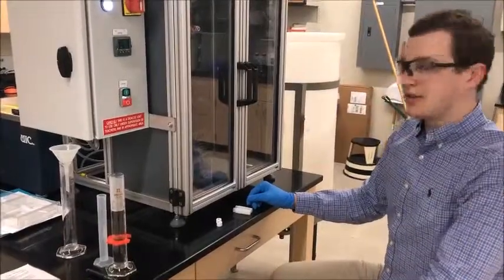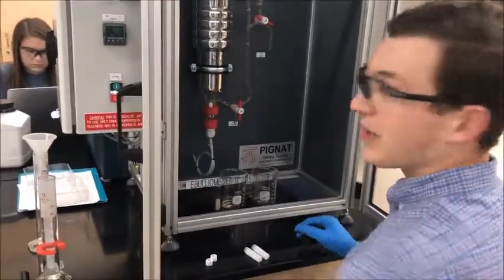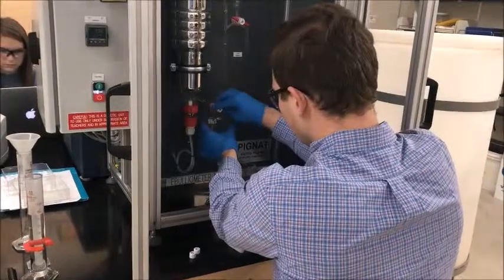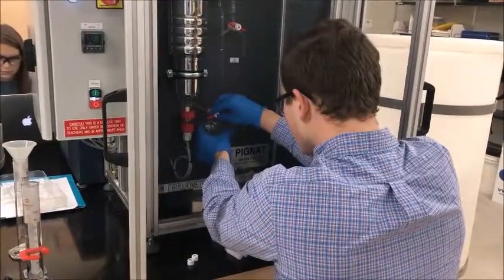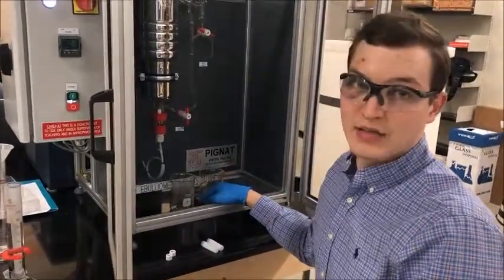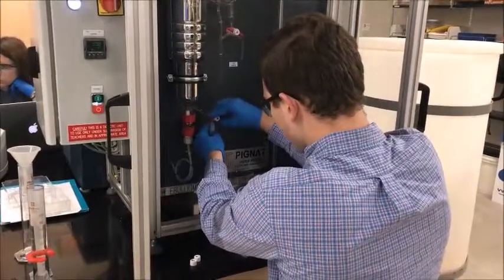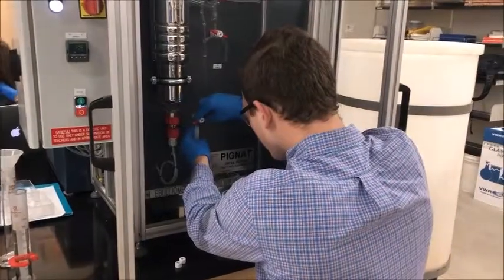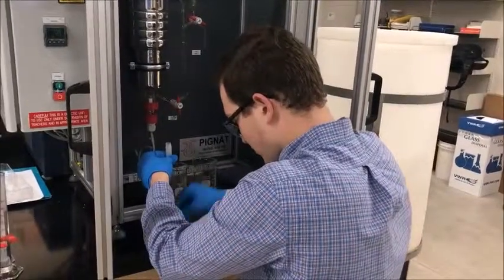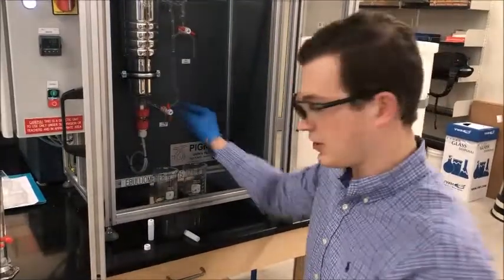When you're finally ready to take your samples, open the cabinet to the system, and then start by draining 15 milliliters out of each valve. Save this liquid as it will be recycled after the sample is taken. The reason we recycle that fluid through is to clear the line so we get a pure sample.